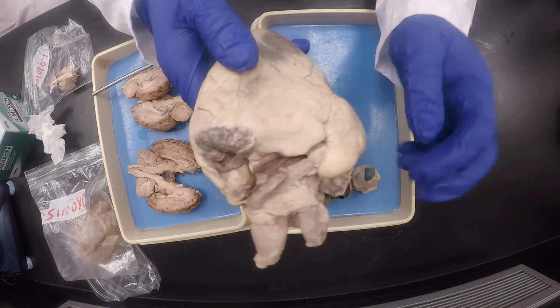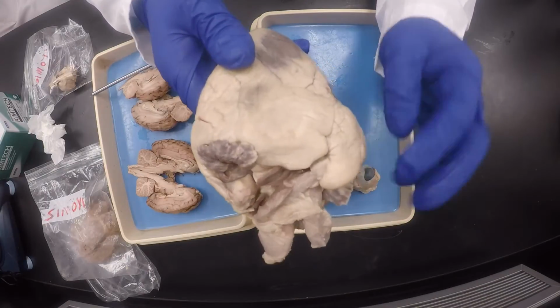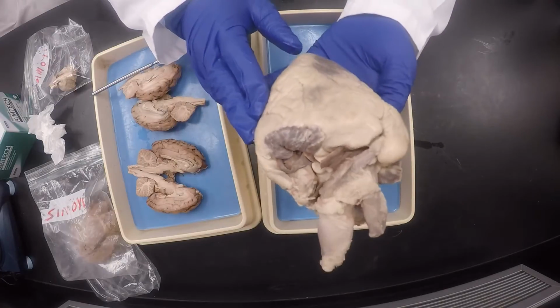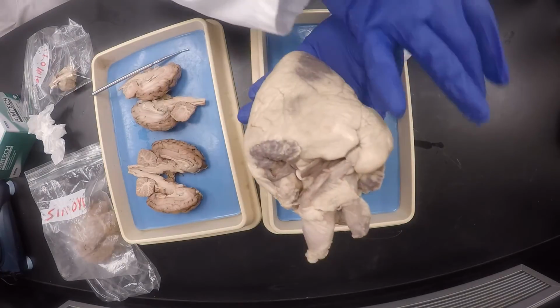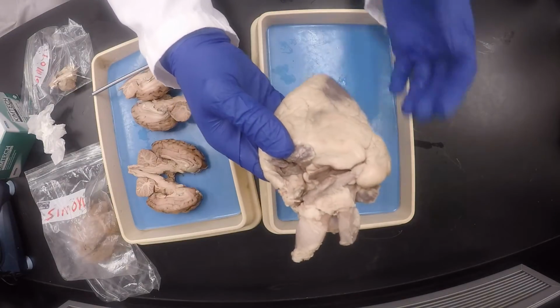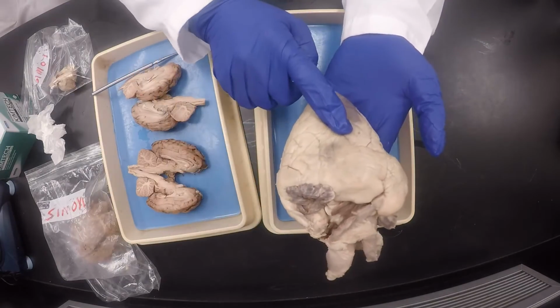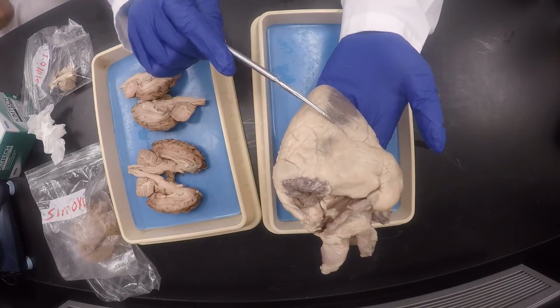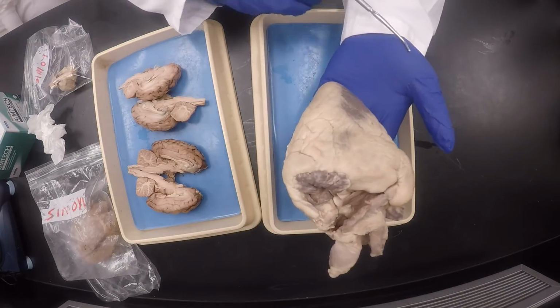Again, like I say, sometimes the heart, because it's deformed, this is not central. So top right, bottom left. Okay, so that divides the heart into the left side and the right side. Okay, because when somebody's facing you, you shake like that. So if I put a pin here, that will be the left ventricle. If I put a pin on the smaller part, right ventricle.